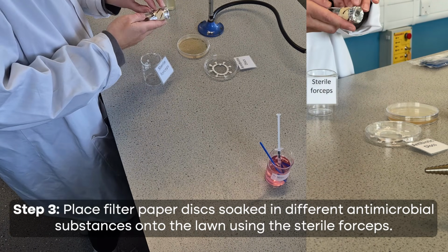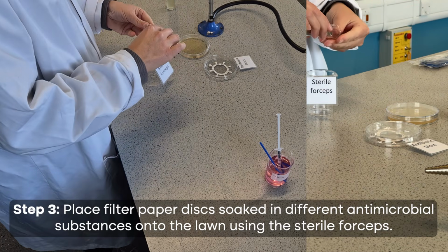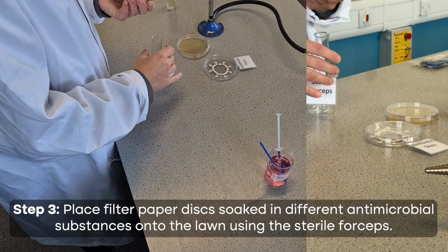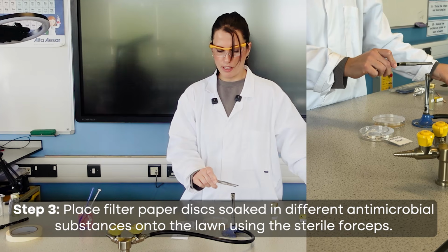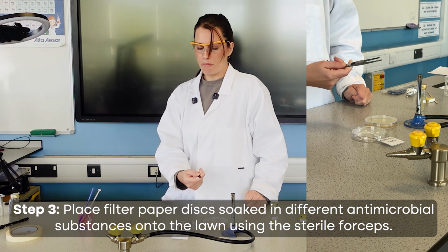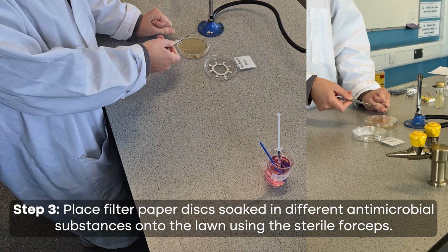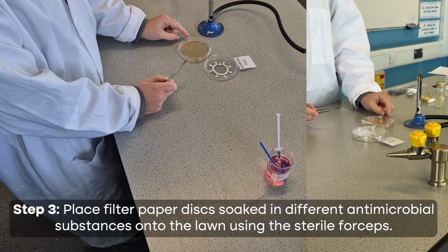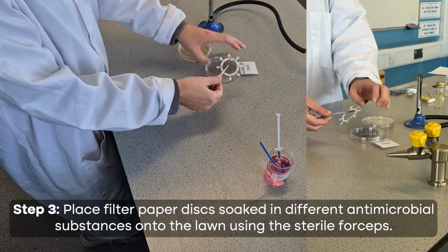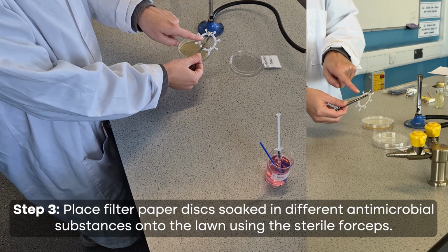Now these have been sterilized already. As soon as we take the top off though, they're now exposed and they might not be sterile. I would still actually put them through there just to be sure that they are definitely sterile. But because I've now put them in the Bunsen burner, I do just need to leave it a little bit to cool down, so it's not going to kill any microbes if it does touch that. Now this has actually got a little bit here on the mast ring, that's what we call this ring of antibiotics, that I can hold onto with the forceps.